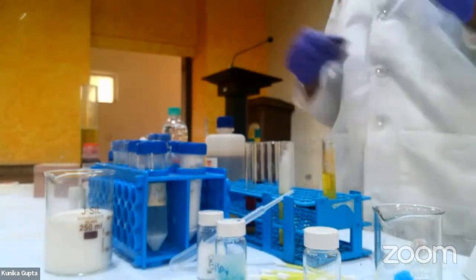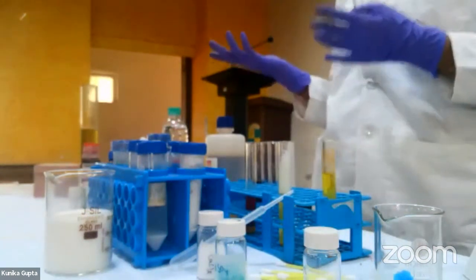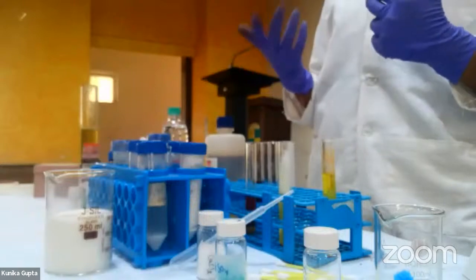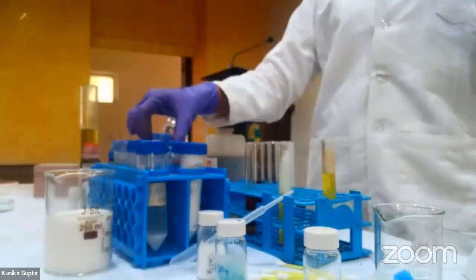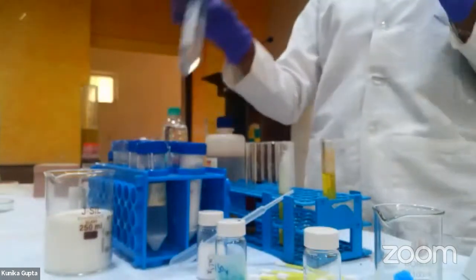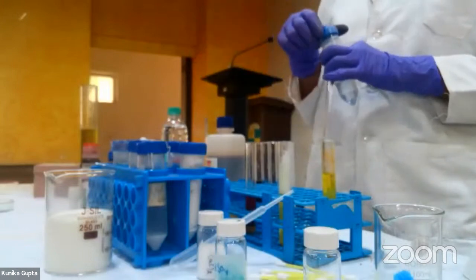Okay. So it does not mix, like oil and water do not mix. Right? So similarly, we have solvents in our lab, things which do not mix. So for this reaction, I'm not taking water. I'm taking dichloromethane because whatever chemicals I have are not water soluble.